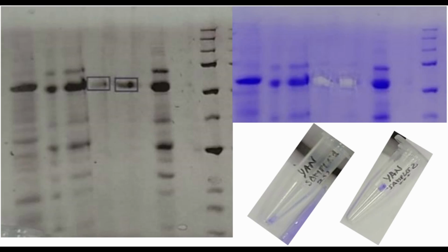Peptide mass fingerprinting. Even though the purified protein has the molecular weight of the protein of interest and a histidine tag, just in case an identification of the protein is performed through the peptide mass fingerprinting technique.